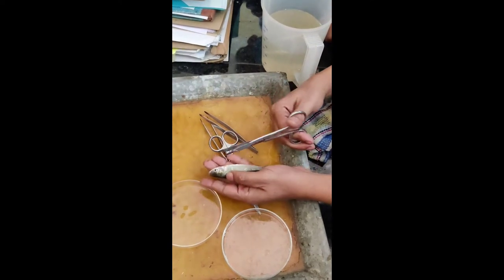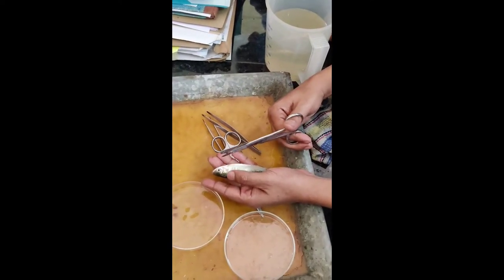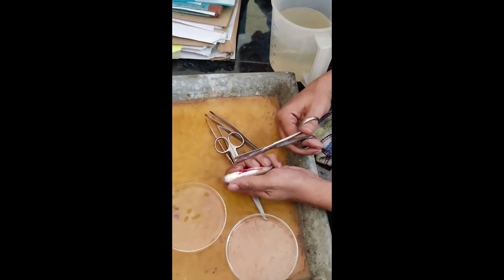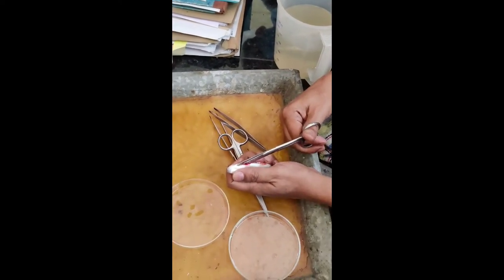The thymus resides in this portion — the branchial cavity portion. It's very small and very difficult to locate. Even for small fish, it's very difficult to get the spleen.